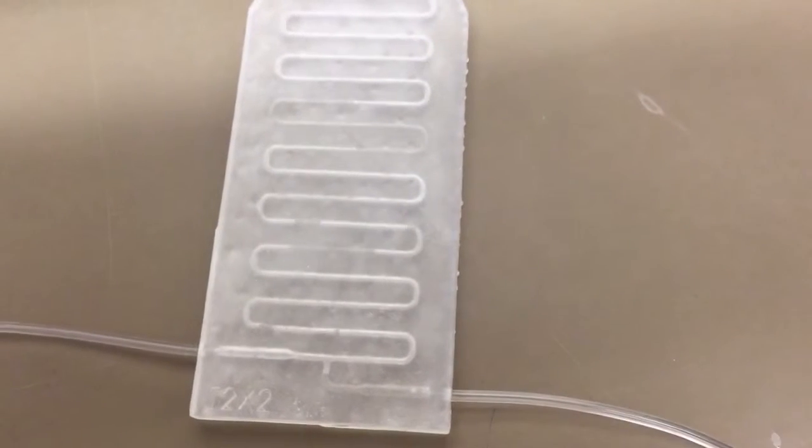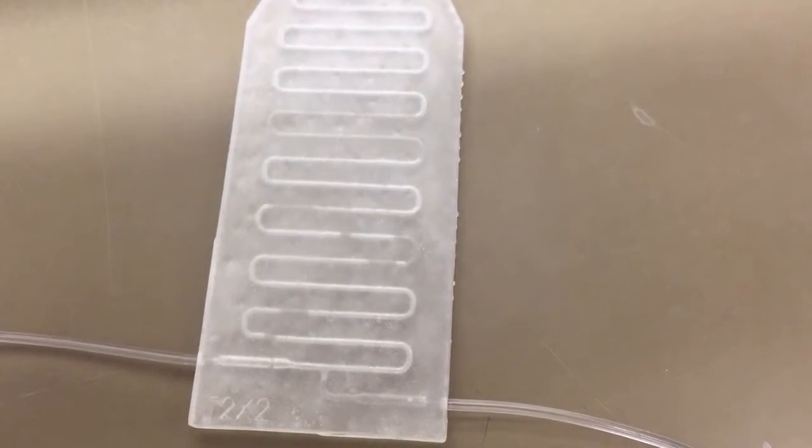Okay, okay, one drop. Oh wait, do you see that? There's a drop. I'm generating control, okay.